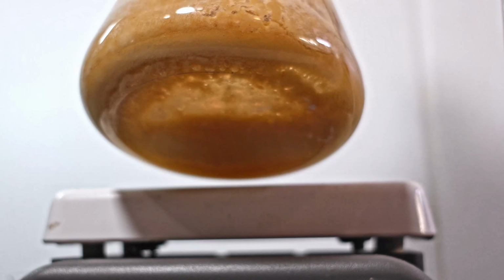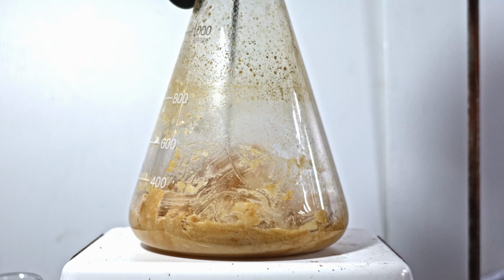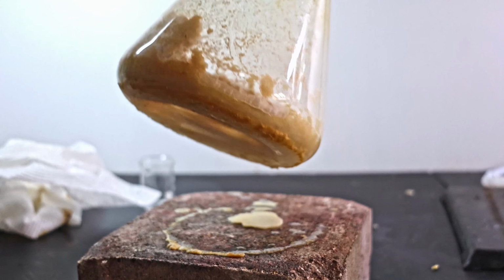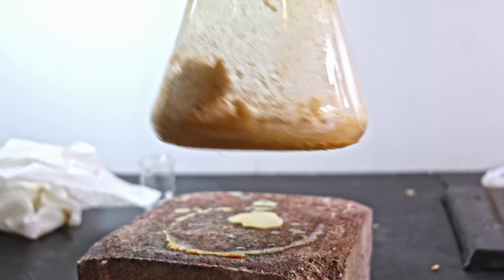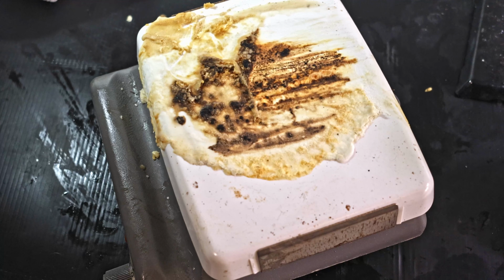I melt it down at a little over 6 on my hot plate. It becomes much more stirrable, and even the stuff on the walls comes down. Then, the accident happened. Right before I started filming, I noticed molten exudate coming out of the flask. I had to work fast, so I wasn't able to film the leak or the emergency cleanup. Long story short, the molten ethoxide ate through my flask and leaked over my hot plate.